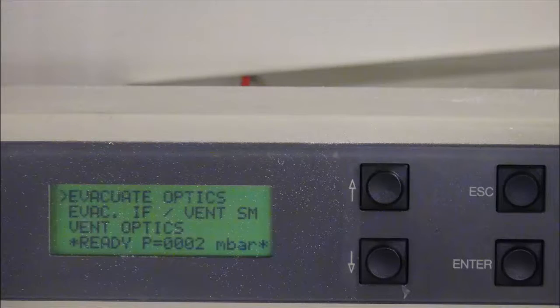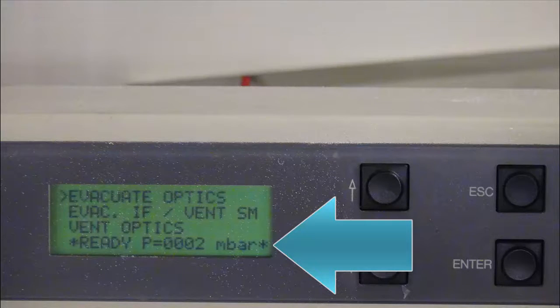You need to make sure the system is under vacuum by checking the console screen. It should say ready and the pressure, P, should be really low.